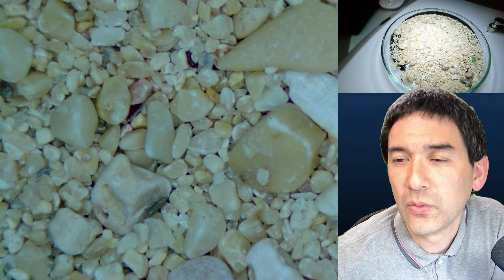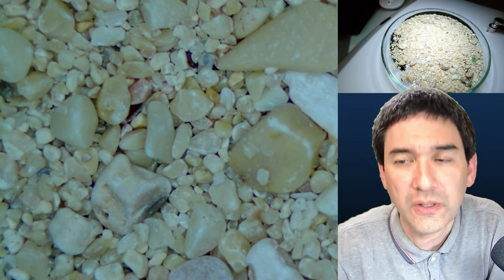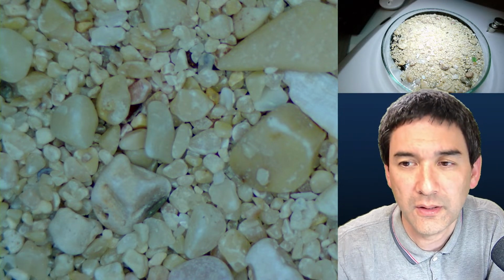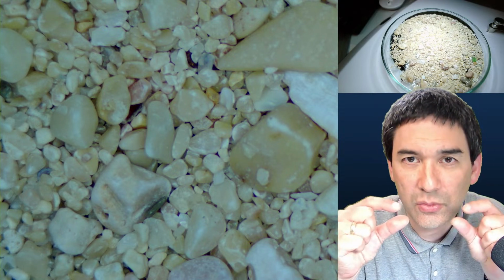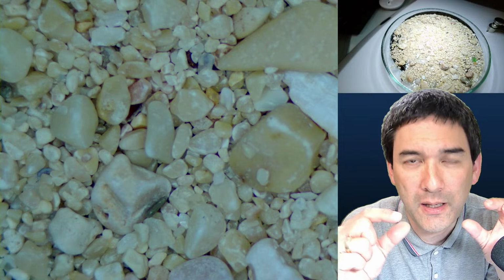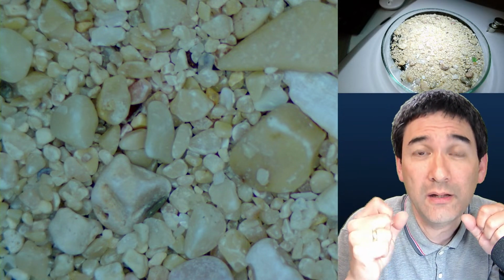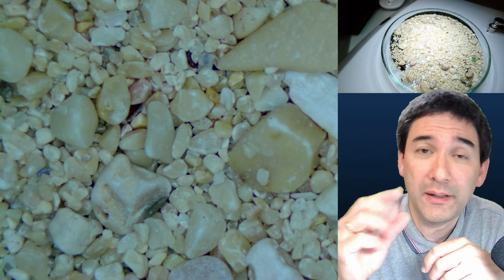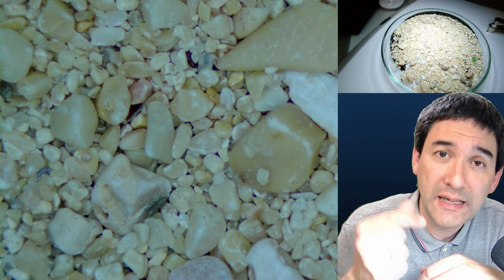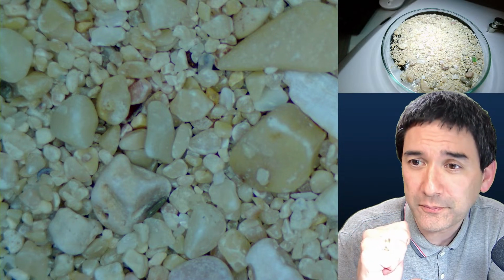That's an interesting one. What you could try to do is put them next to each other. You can see if they really magnify the same by looking at some text. Or by looking at a lamp and projecting the lamp like a lens, and then see if there is a difference in the size of the projected image.